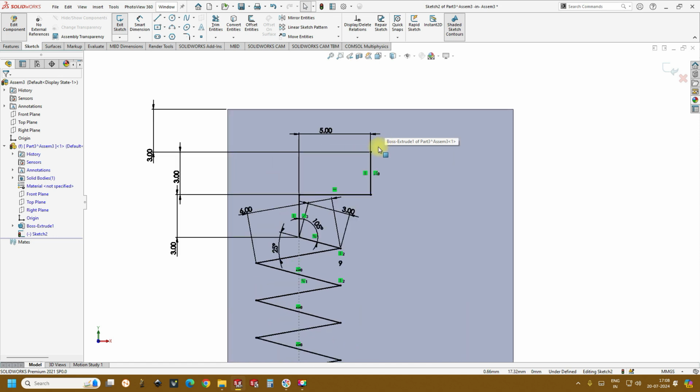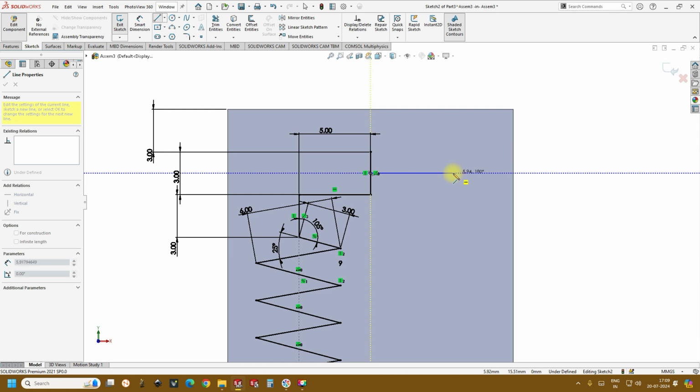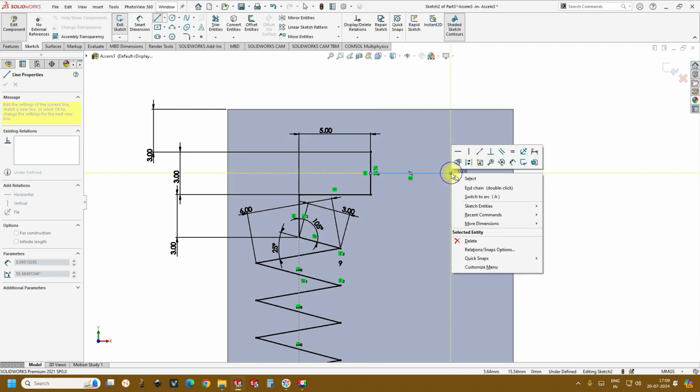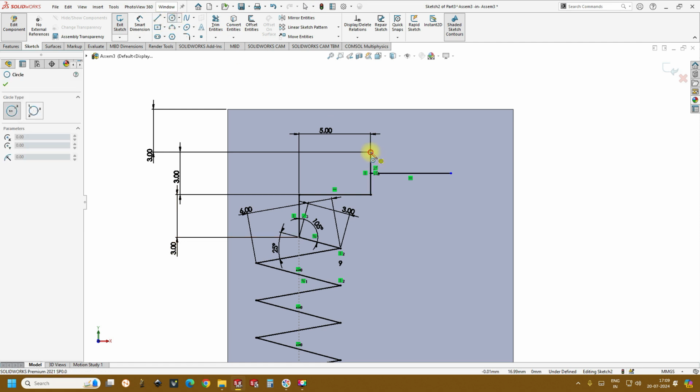Okay, and now if you see, this is one inlet. Let's say here there's one inlet, and the second inlet we can create somewhere in the middle. This can be the second inlet. Okay, and then this can be the inlet.